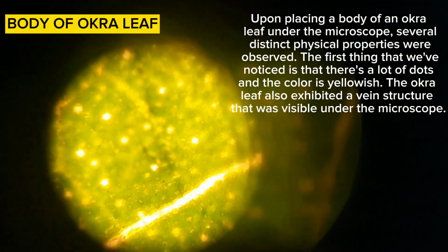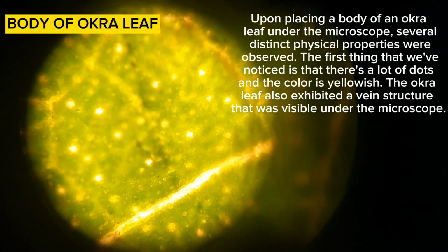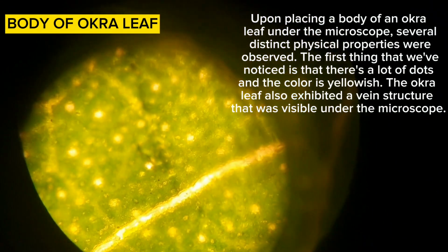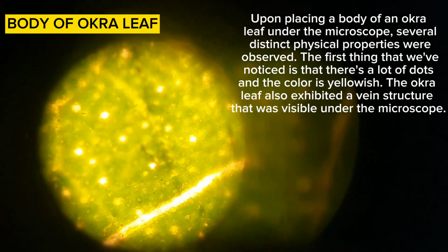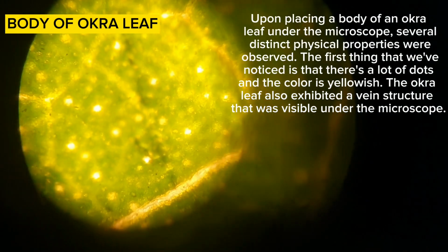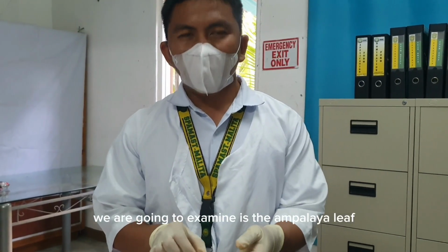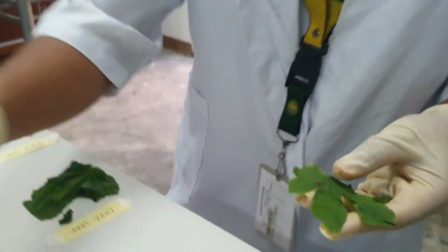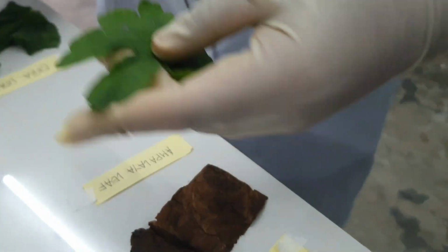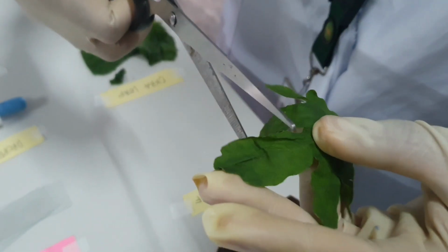Upon placing the body of an okra leaf under a microscope, several distinct physical properties were observed. The first thing that we noticed is that there are a lot of dots and the color is yellowish. The okra leaf also exhibited a vein structure that was visible under the microscope. Okay, the next that we are going to examine is the ampalaya leaf. We're going to cut the edge.